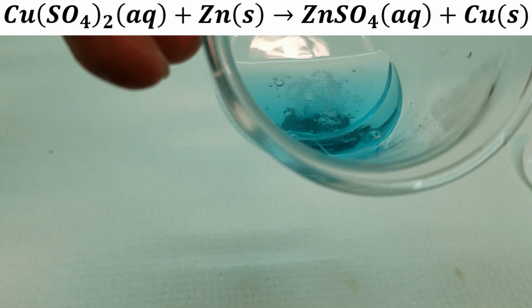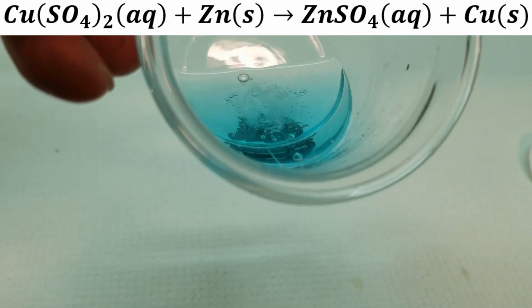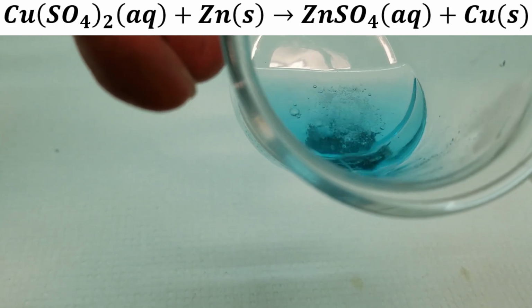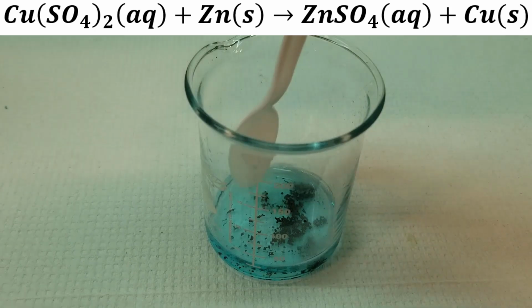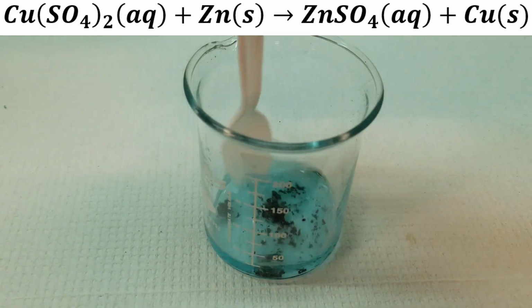Okay, you see the bubbles coming off, that's the hydrogen gas. Hopefully you're seeing some little flecks of brown powder. The brown powder is, of course, the copper metal coming back out of solution. And you see some of that brown powder forming there in the middle.